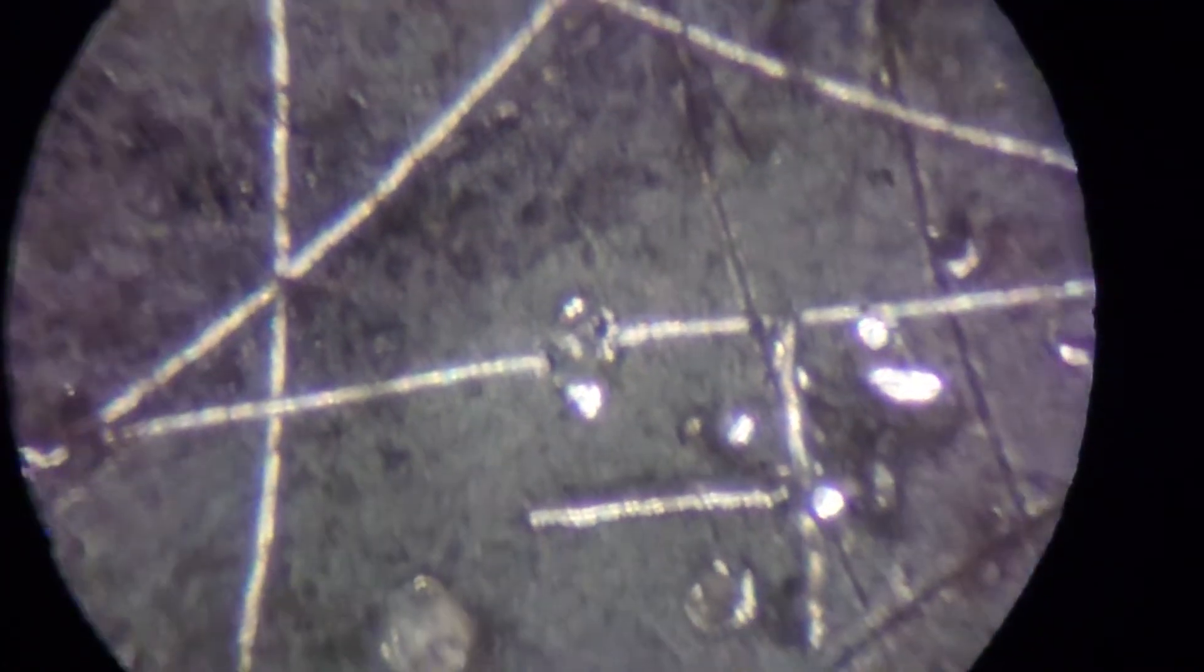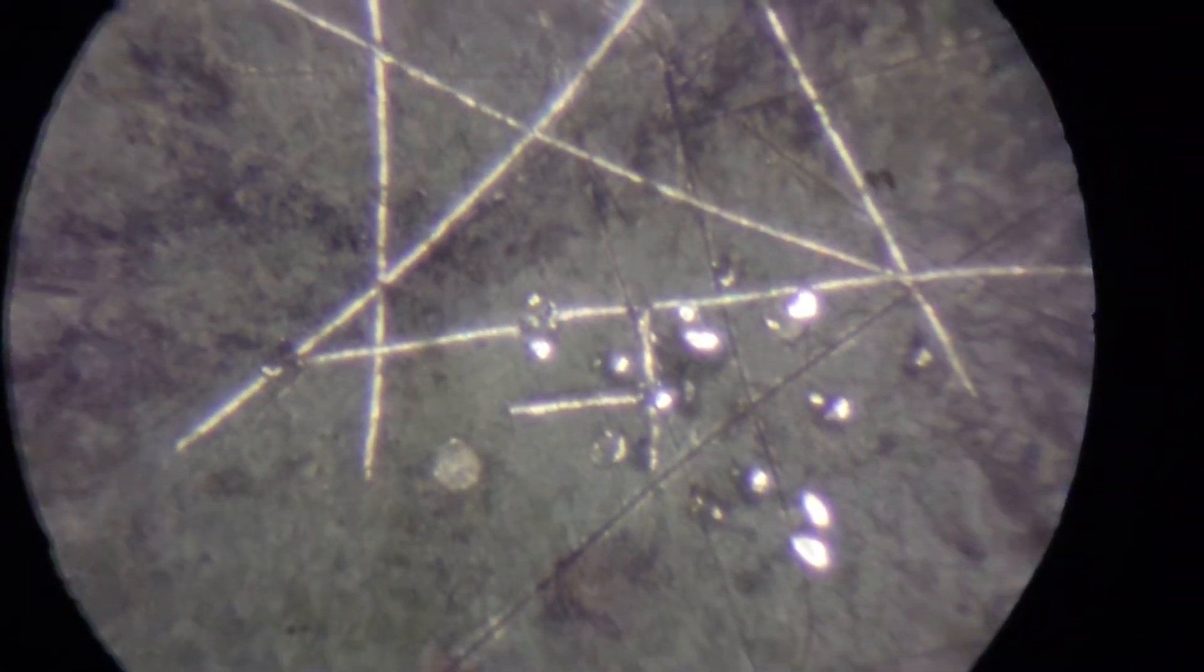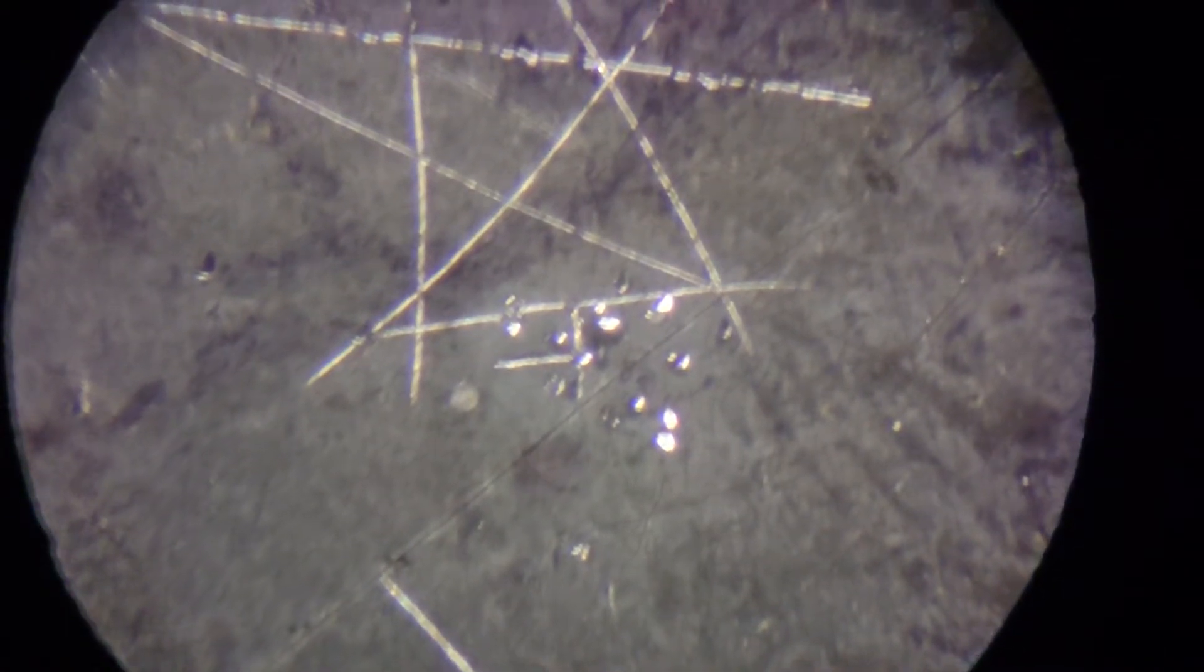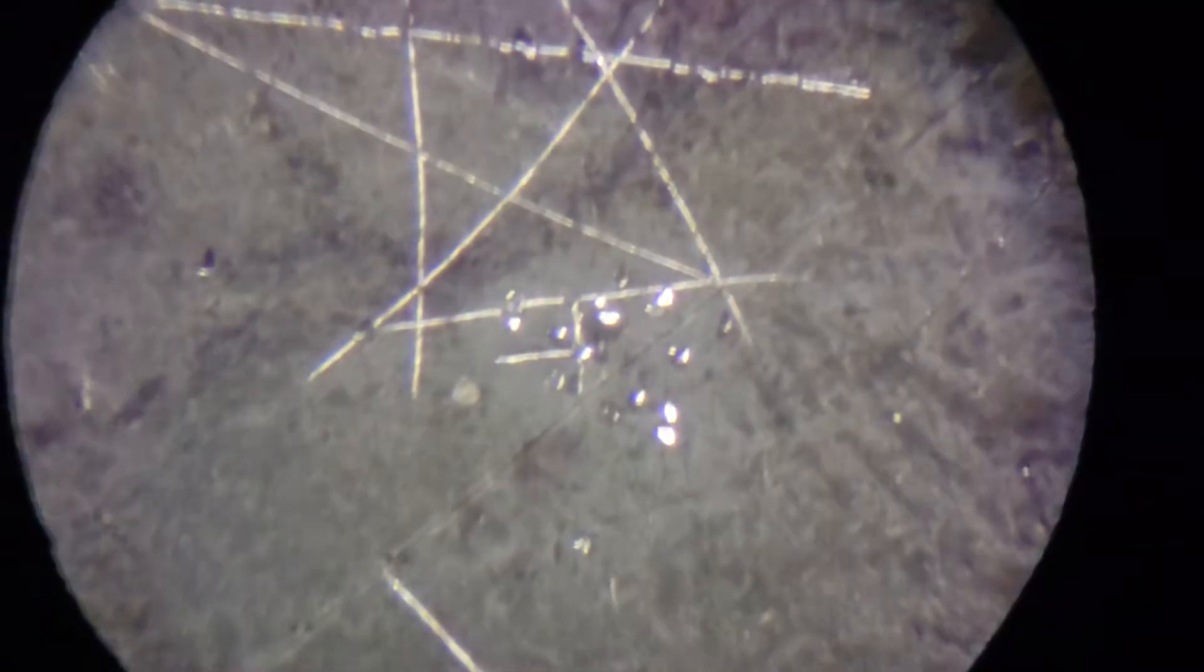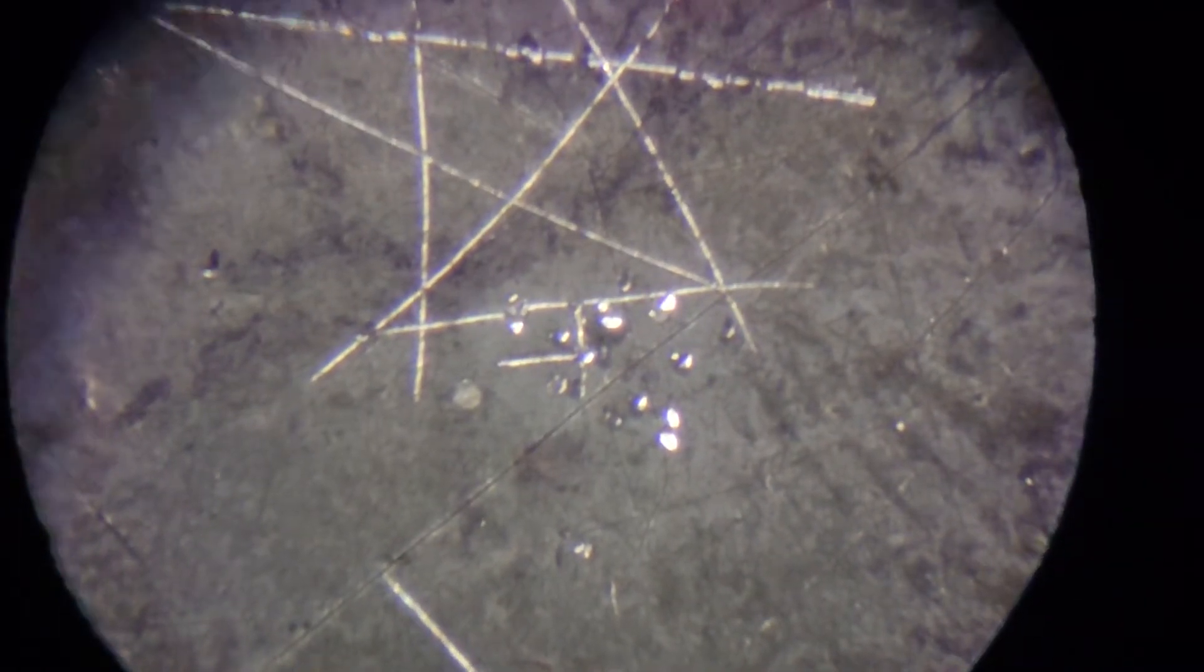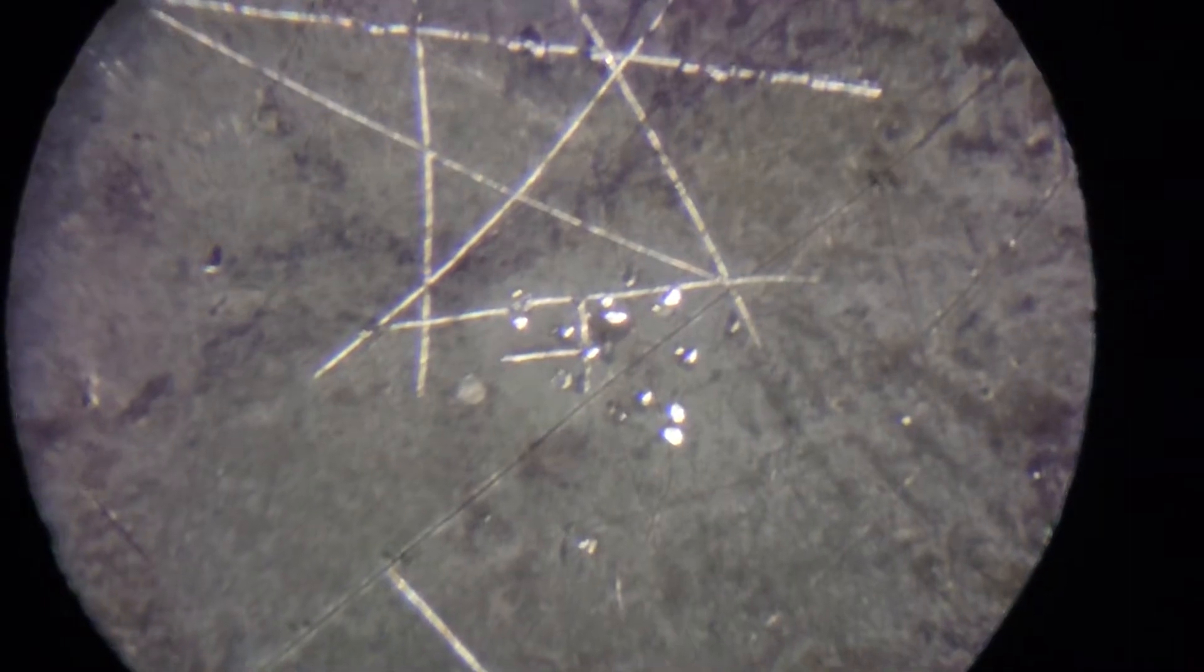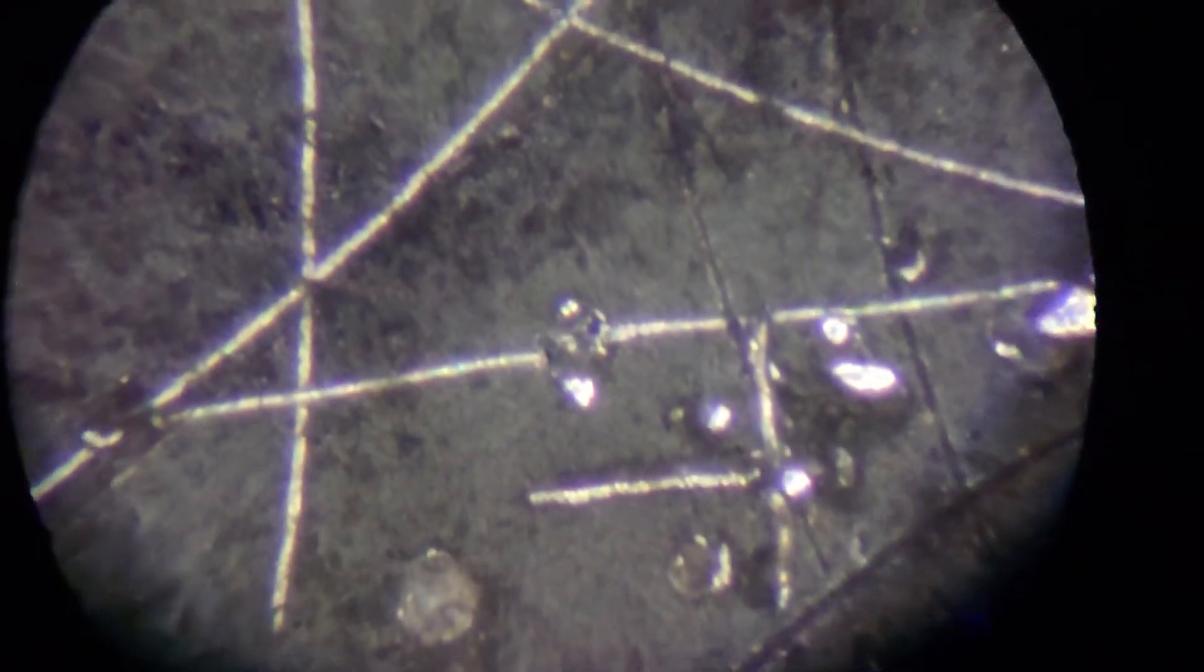Mechanics gives us no loose actions and the focus is sharp, pin sharp, on the whole range. So we need to wait, might be a day, to ensure that varnish won't push elements away from their settled positions.